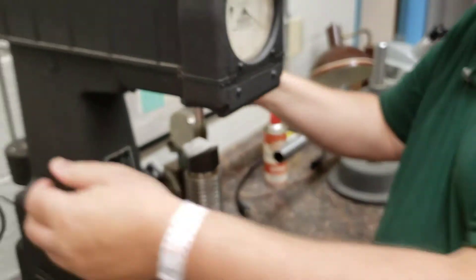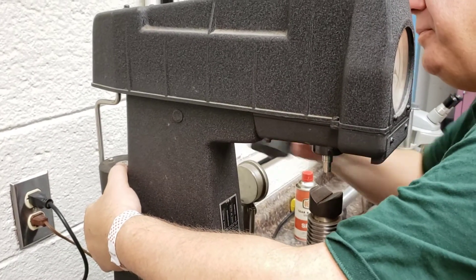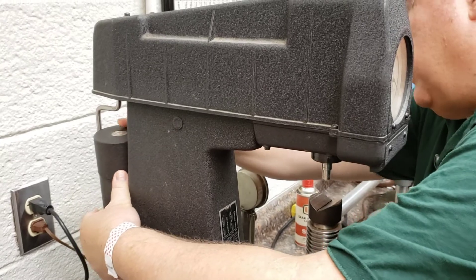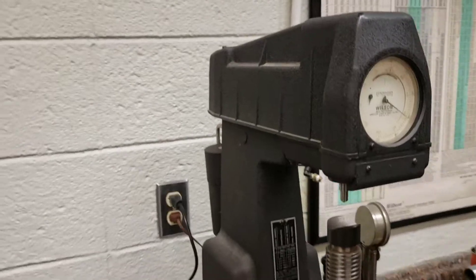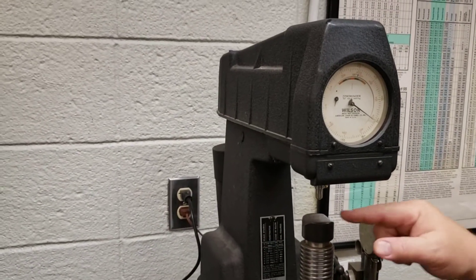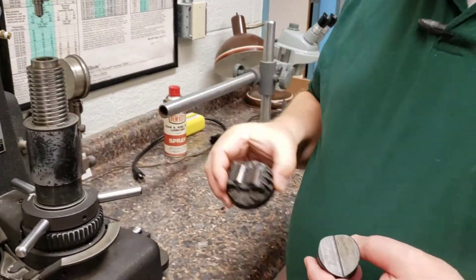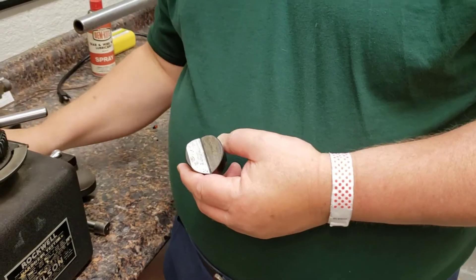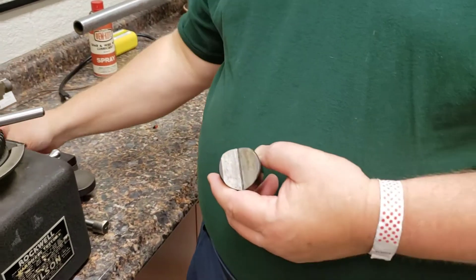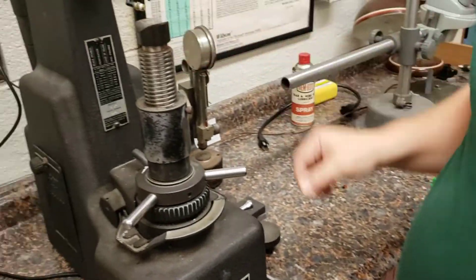You can see this is a little different from the electric tester where we dialed it in — here we stack the weights. There's a flat on these weights so you know which face goes toward the machine. We're using a round specimen set now. We have a couple of bases, and also some very small ones for wire samples, so we have a lot of different bases and you use the one that fits.